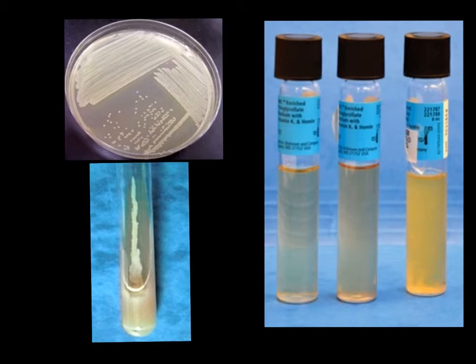Now if we are doing a procedure where we're working with a bacteria colony that is in a nutrient broth, one of the things we want to be aware of is that our bacteria can settle towards the bottom of our test tube, and we want to make sure that we get enough of our bacteria source and place that on our slide.